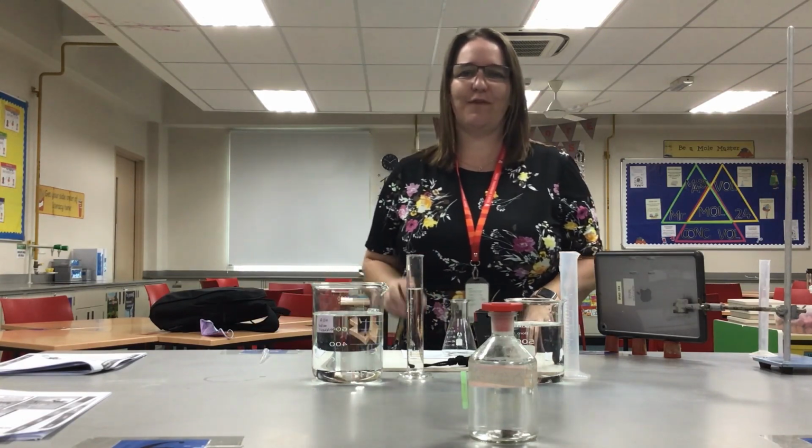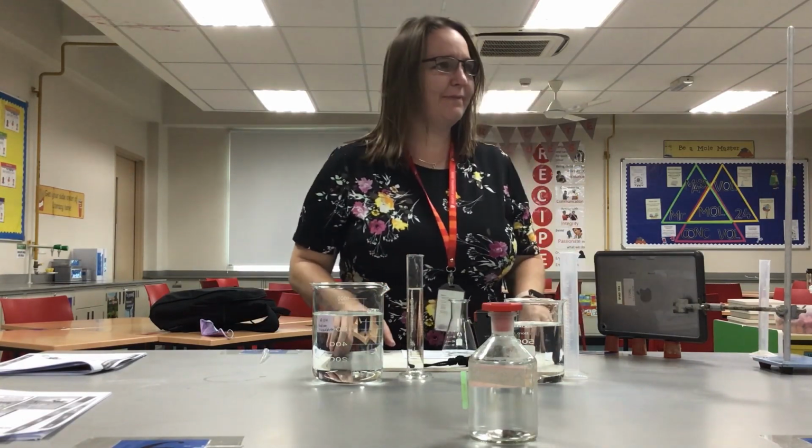Hello lovelies. In this experiment we are going to look at how changing the concentration of the reactants affects the rate of reaction.